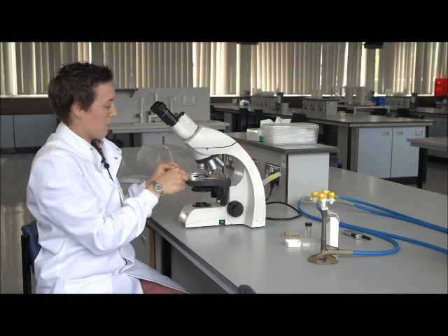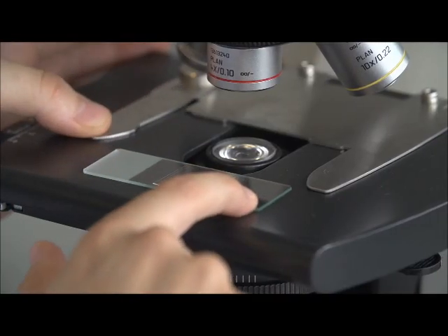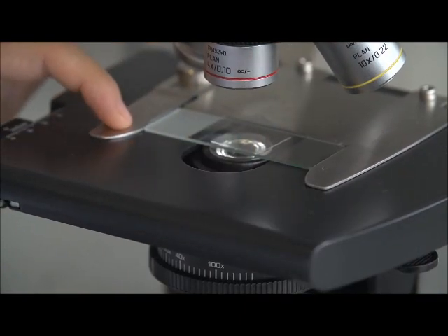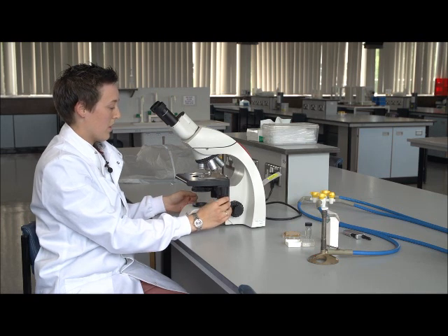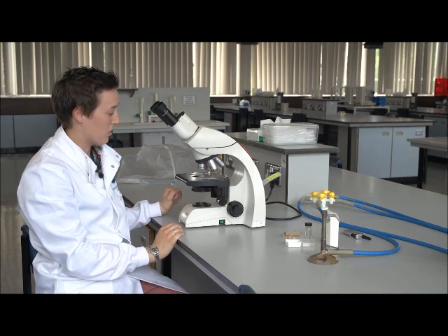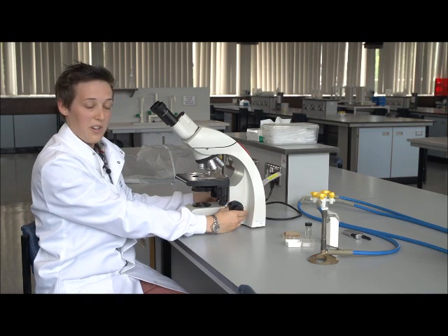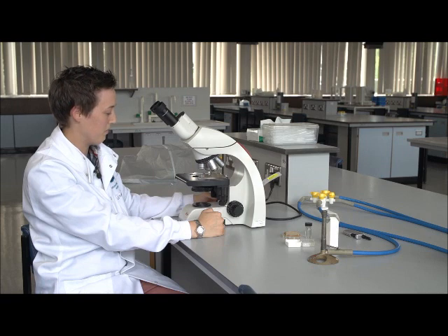So now we need to load our specimen onto the microscope. To do this, we just pull back the holder there, slide our slide in, and let go. This will then hold this in place and allow us to move our cover slip around. So center our specimen, and what we're going to do is start at the lowest magnification first and then work our way up. A good rule of thumb to find your sample quickly is to start with the stage up at its highest point, which it is here. You should be able to find your specimen within 1.5 turns from this top position.